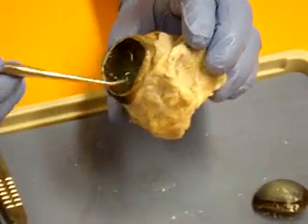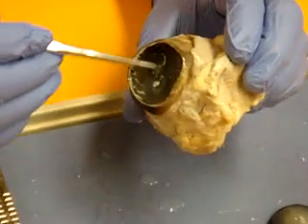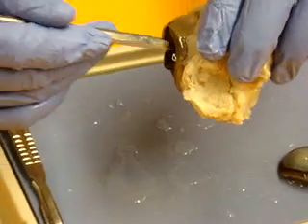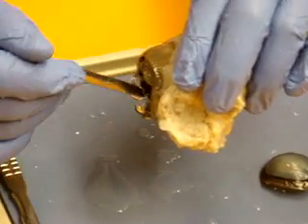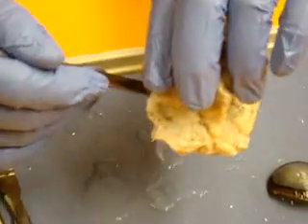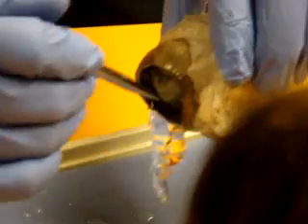If you look through the vitreous humor, you can kind of see a little thin gray curtain — that's the retina. I'm going to try not to pull it out when I pull out the vitreous, but it's going to want to come out with it, because the vitreous keeps the retina pushed against the walls. You can see how that curtain wants to come with the vitreous when I pull it out. See how it's jelly-like?